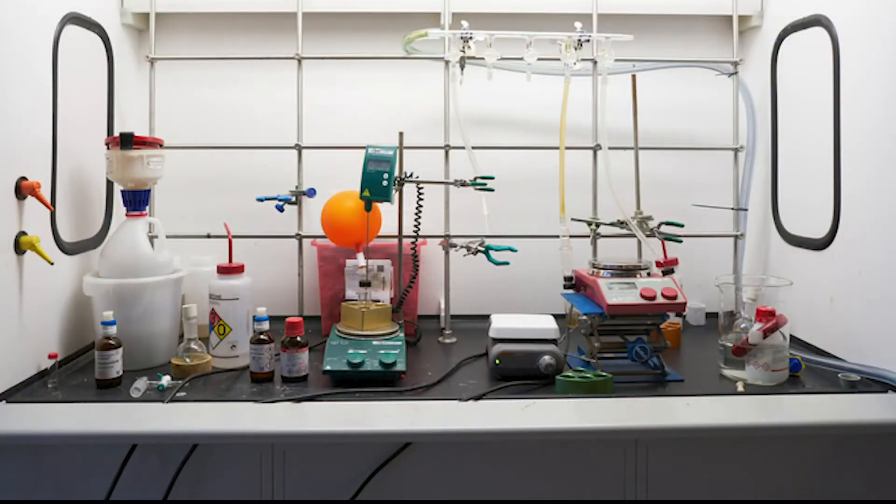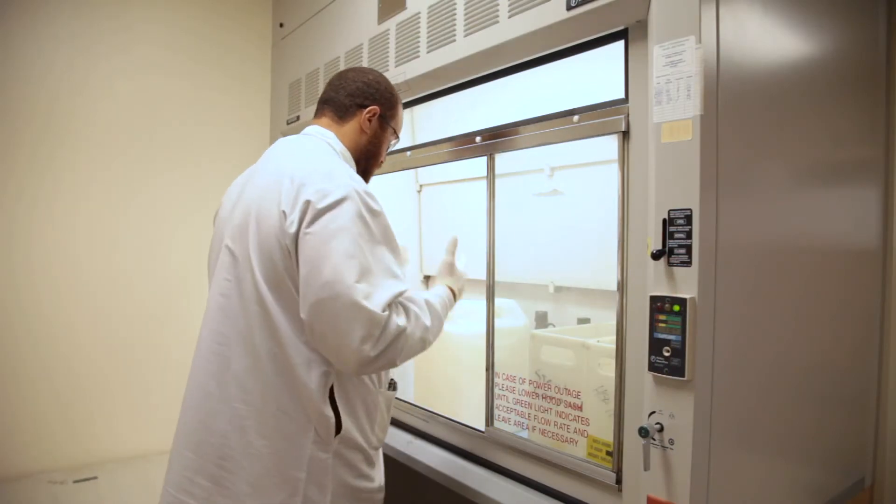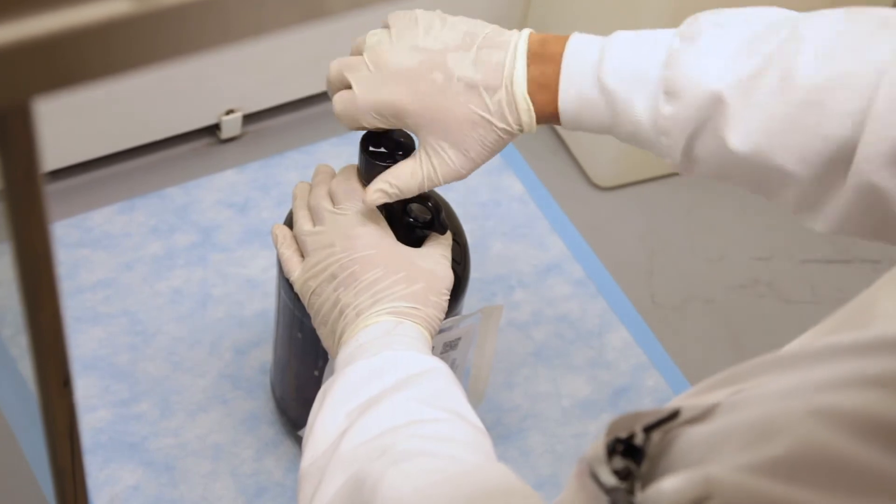Here are some other rules to follow for the safe use of your fume hood. Avoid storing excessive amounts of equipment and chemicals in the fume hoods. All containers in the fume hood must be capped when not in use.